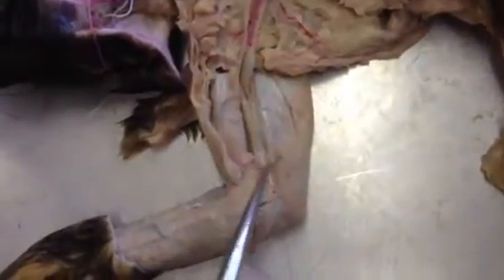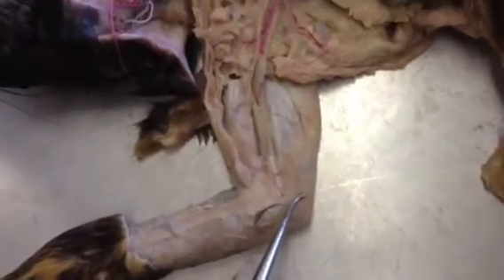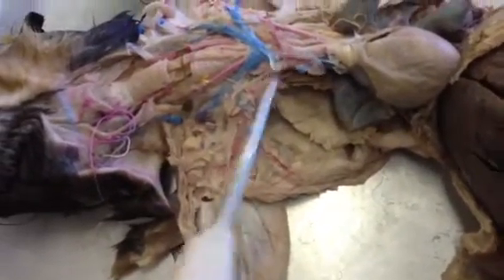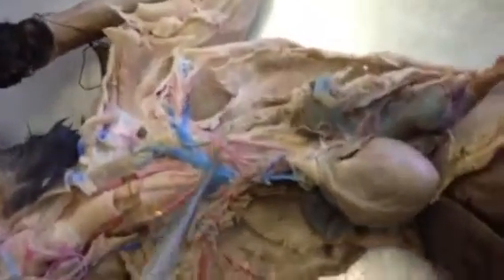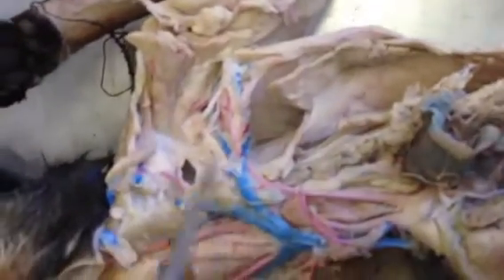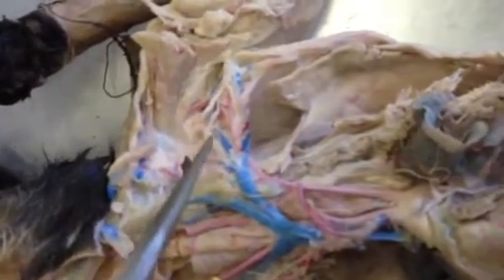And then kind of hard to... Can you point the brachial again? The brachial artery is going to go into the arm. Kind of can't see it right here, but there would be an artery right through the arm. And then the subscapular arteries are going to branch off of either the axillary or the subclavian. If you want to move over to the left side, it could be off of the subclavian or the axillary, but it's going to be a branch that kind of dips down. We don't see them here, but it'll dip down into the body, down towards the scapula. And it's going to be joined by the subscapular vein as well.